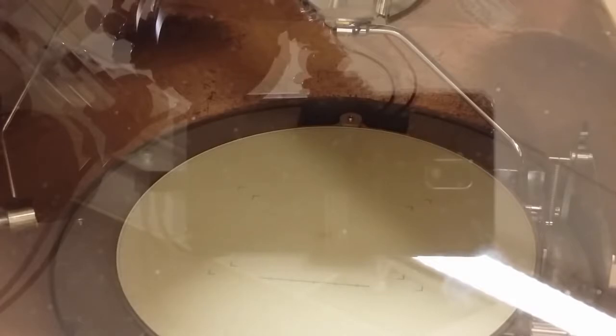I shall turn off the light in the room. The green regions you see is the fluorescent behavior of the fluorescent screen when it's hit by electrons. You see there are green squares, and if I translate the sample, you see that there are these repeats. So the black bars in the picture are the copper mesh of the TEM grid. So the actual sample that we're going to look at is these small tiny black dots that you see inside these squares.